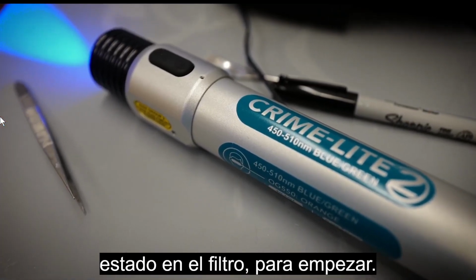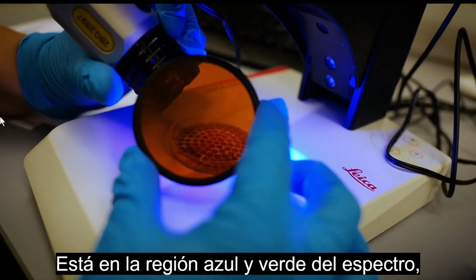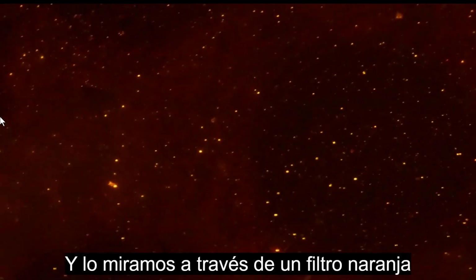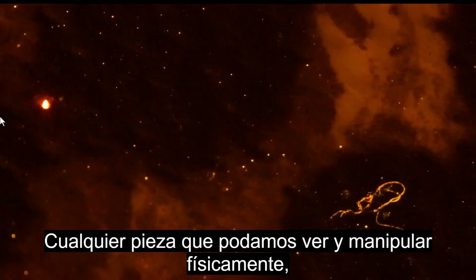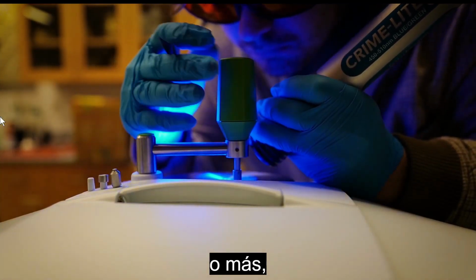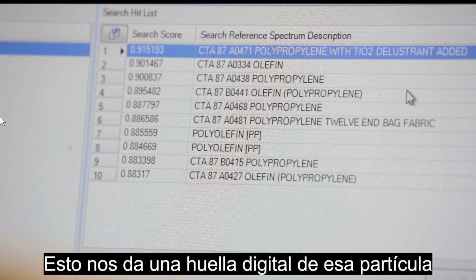Then we use a crime light, which is a light that has specific wavelengths of light that it emits. It's in the blue-green region of the spectrum, which causes the plastic to fluoresce. And we look at it through an orange filter so that we can see those particles of plastic fluorescing under our microscope. Any piece that we can see and physically manipulate, which would be particles about 100 microns or larger, we then analyze by FTIR, which is Fourier transform infrared spectrometry. This gives us a fingerprint of that particle in order to identify the polymeric content.